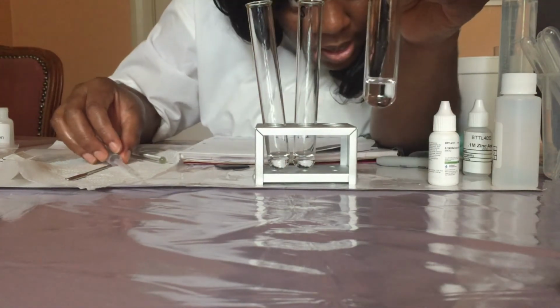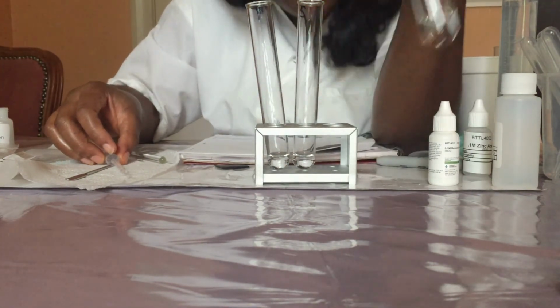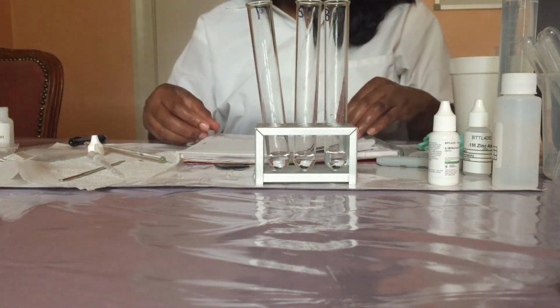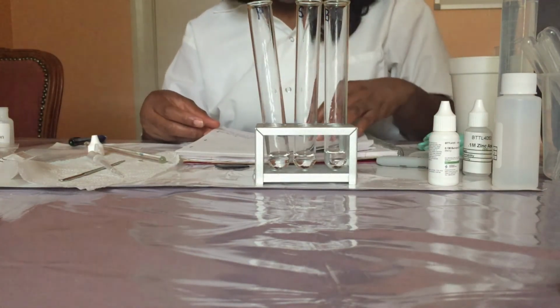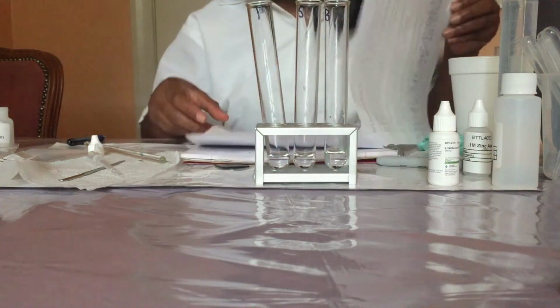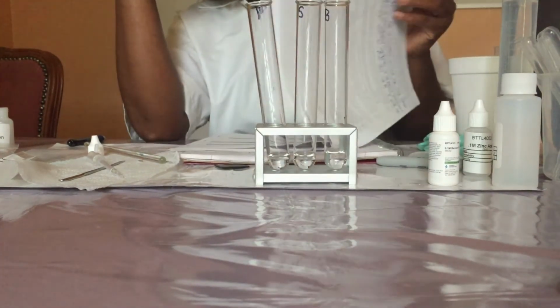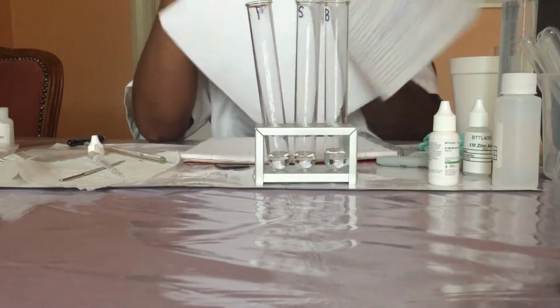And as you can see, nothing happened. And I will indicate my results in table 4.